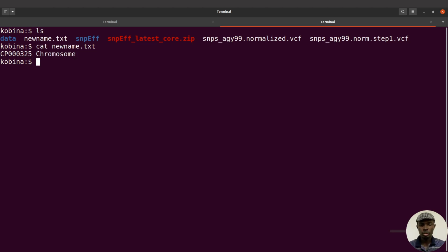We will use BCF tools, and to do that we will say bcftools annotate --rename-chrs, like this. That means we are renaming the chromosomes, and then we specify the text file which has the information, which is newname.txt. And then I will specify the output format. Okay, so I will say -o.